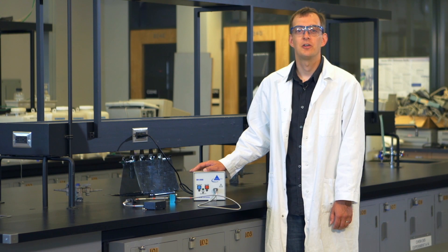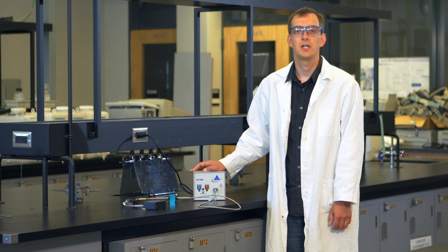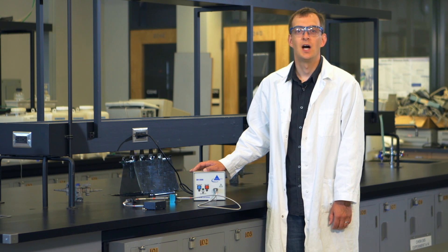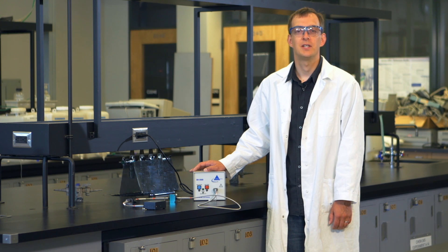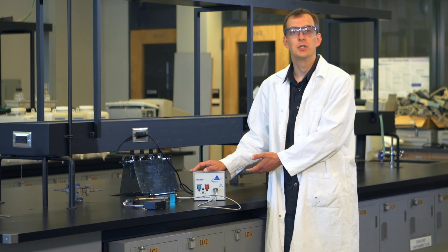Hello and welcome to this series of instructional videos for the third year analytical chem labs. I'm Dr. Robin Studley, and this video will be about the instrumental setup for fluorimetry.